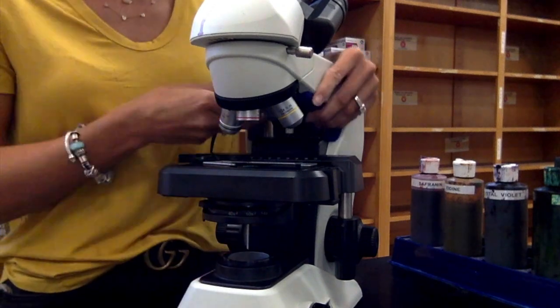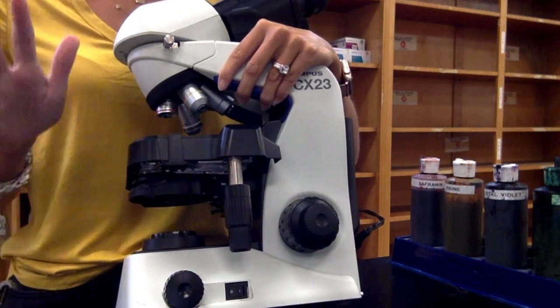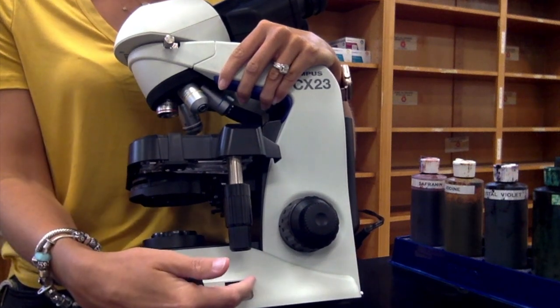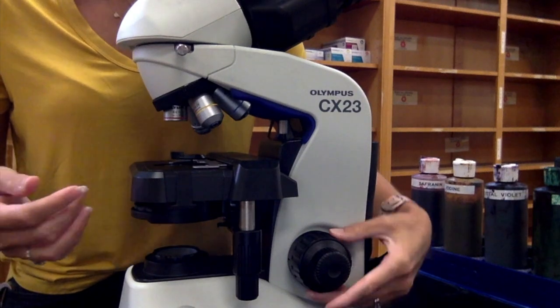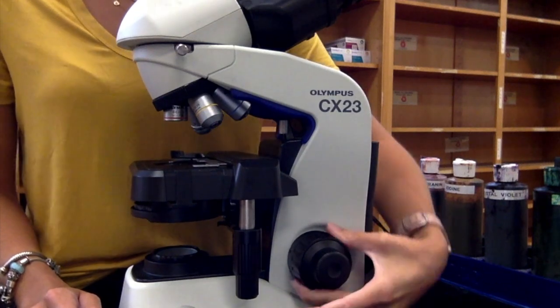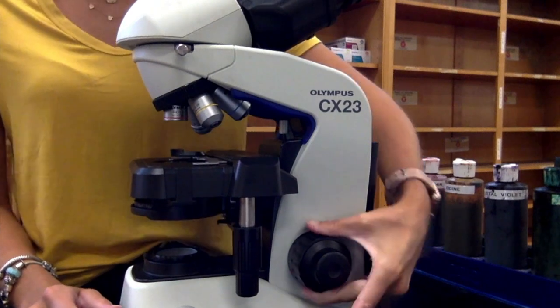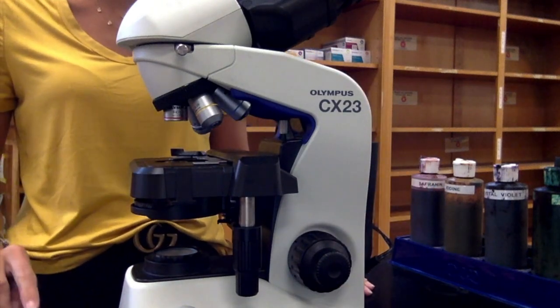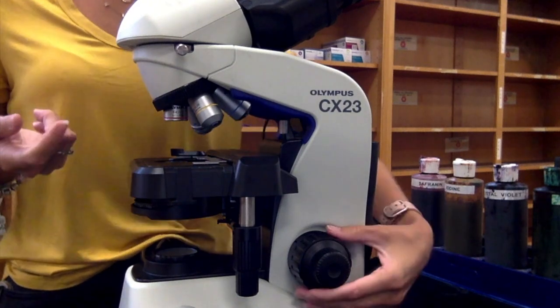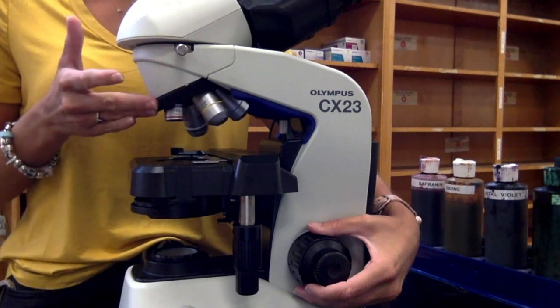Here's the light source and the light intensity knob. These have LED bulbs — very bright white bulbs — so if the light is too intense you can turn this down. Here's the on and off switch. And then here are quite potentially the most important knobs on the microscope: the coarse adjustment, which is the large knob, and the fine adjustment. The coarse moves the stage up and down in large increments and the fine moves it in small increments. The only time you should touch the coarse adjustment is when you are on the 4x objective lens, because moving in large increments on the 100x could crack the lens or your slide.